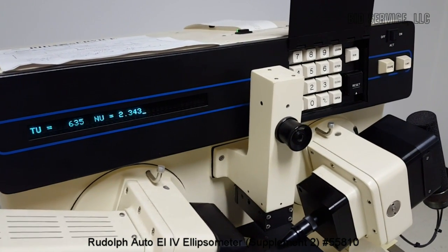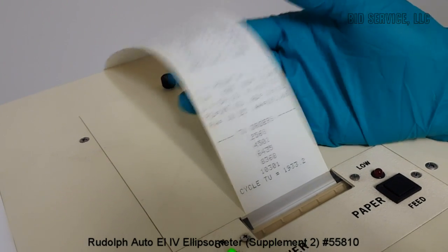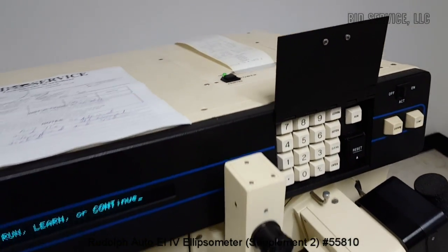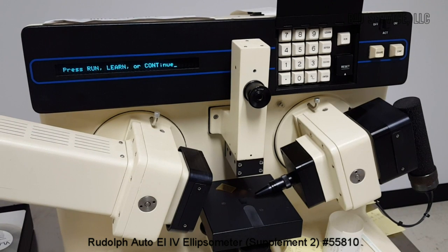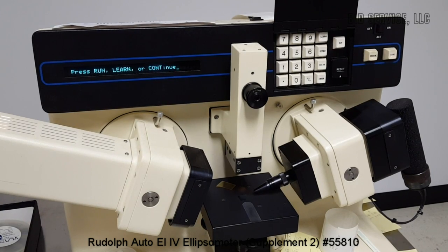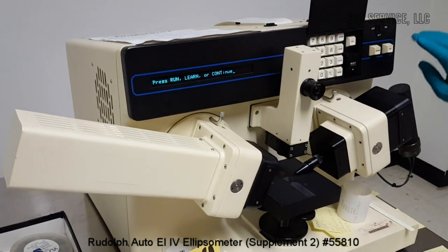So this measurement routine I have selected, and the calculation routine. I did calculate the refractive index of the film and gave it as 2.34. So this system can be also used by using program number 70. We can calculate the parameters of substrate parameters such as refractive index and absorption coefficient. So the measured film thickness with this program is 635.